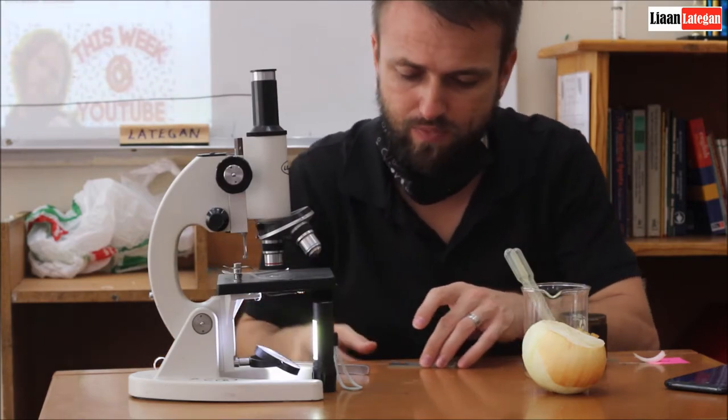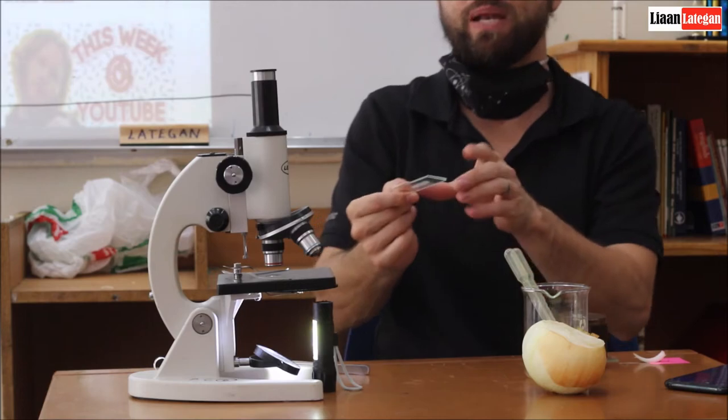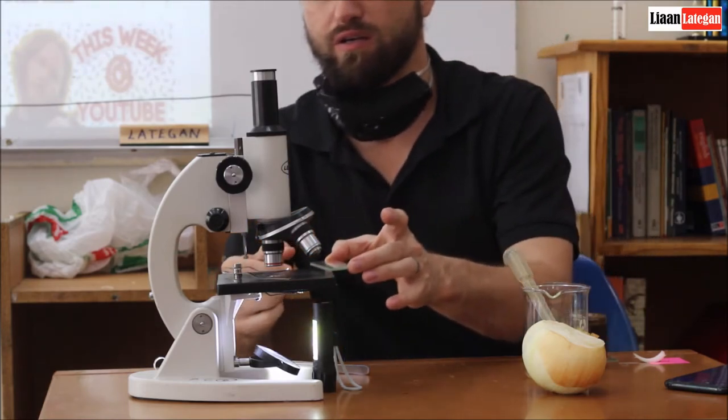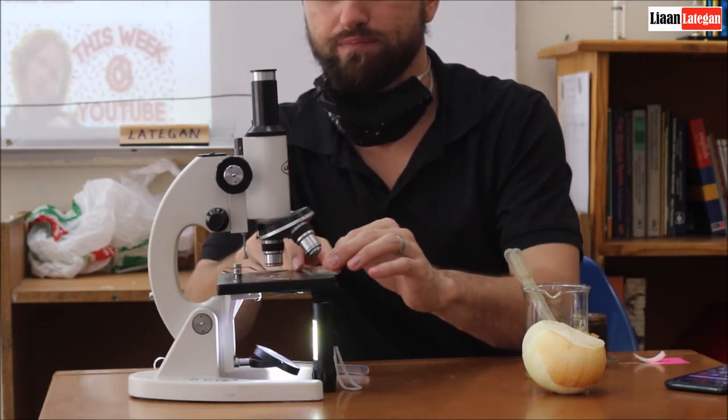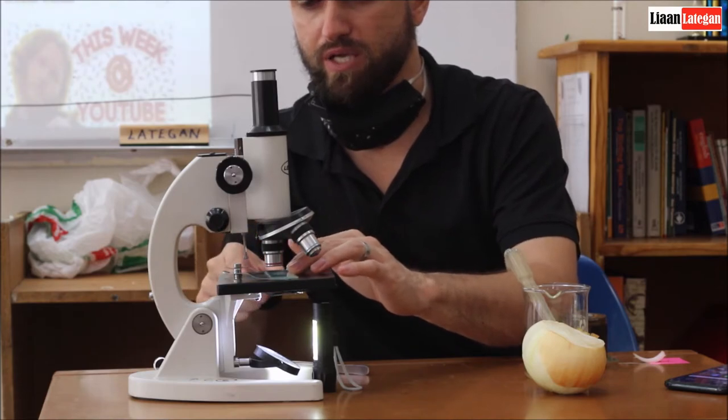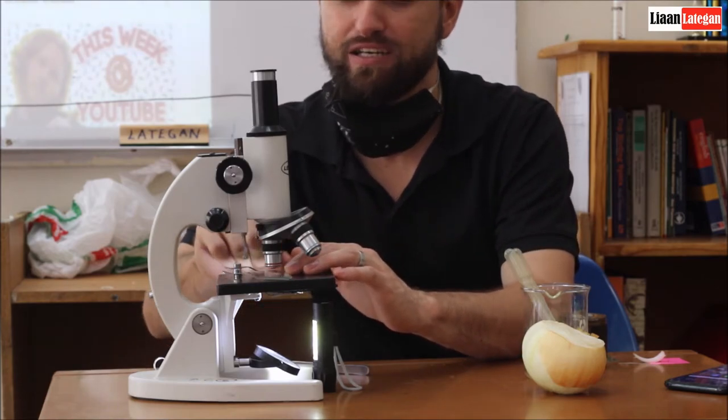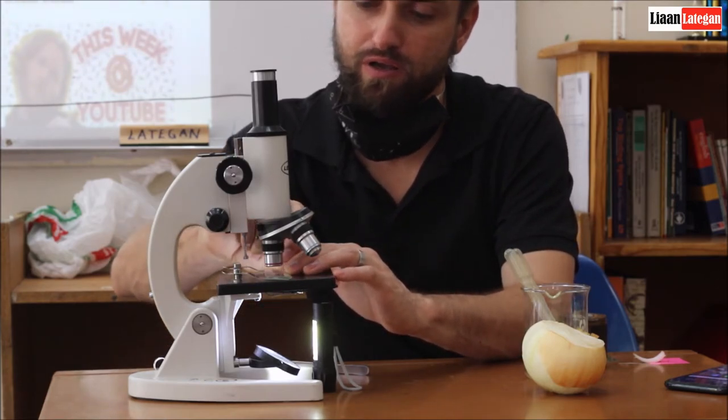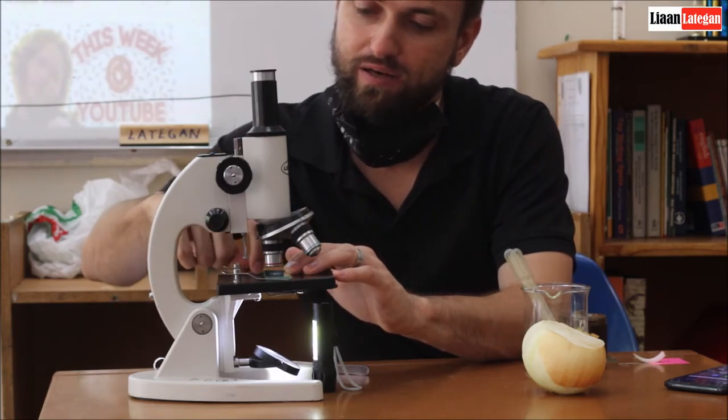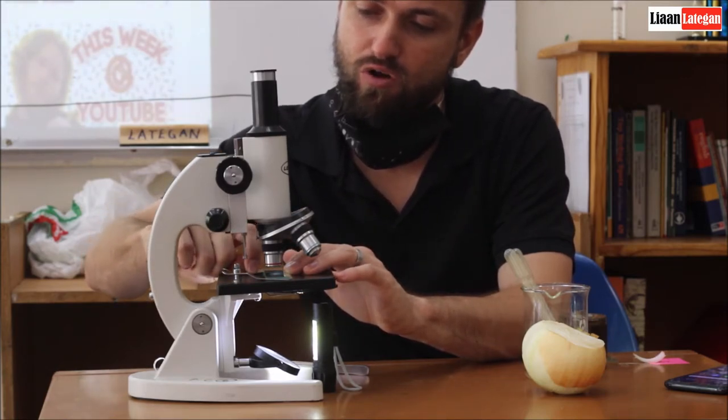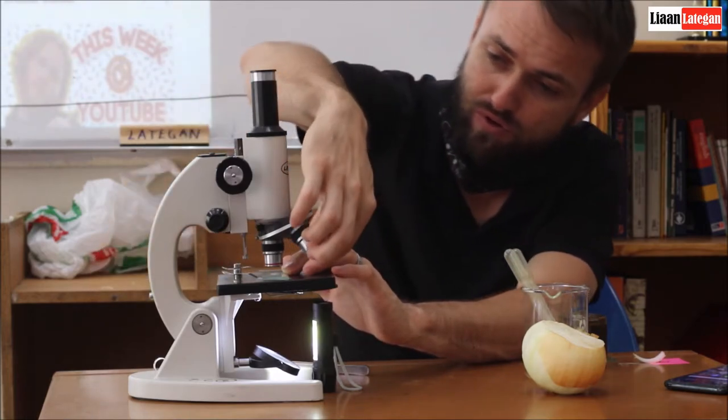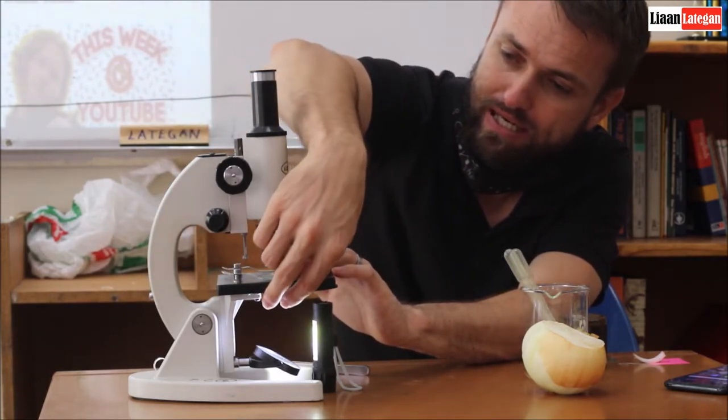Then I'm going to be placing it on the platform here, making sure that the light can shine through the skin. And I'm going to utilize these arms to just clasp or the clasp to clasp onto the plates.